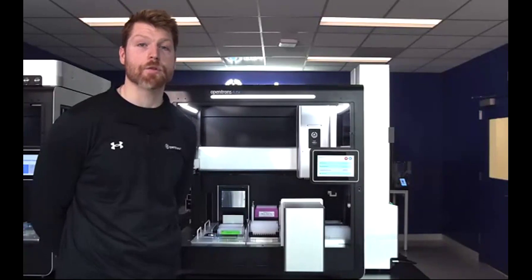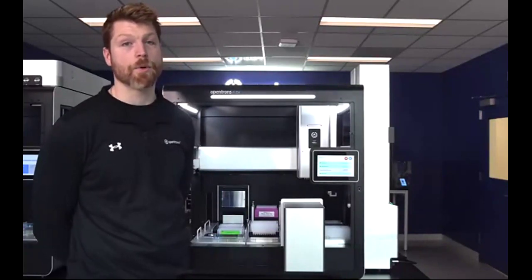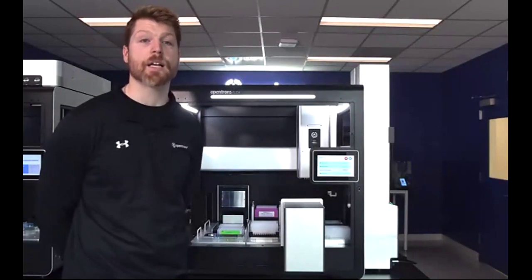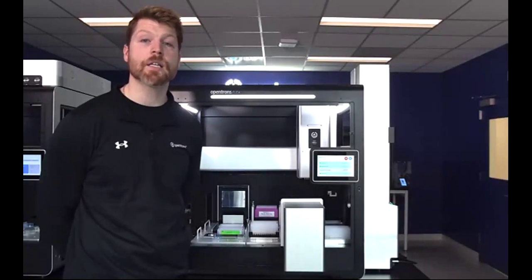Also on this high throughput workstation are a variety of our other modules. There can come with up to 3 or 4 on deck modules. We highly recommend that you have our thermal cycler, which is automatic opening and closing, with the new gripper compatible auto sealing lids, which fit on top of labware that can sit within the thermocycler.